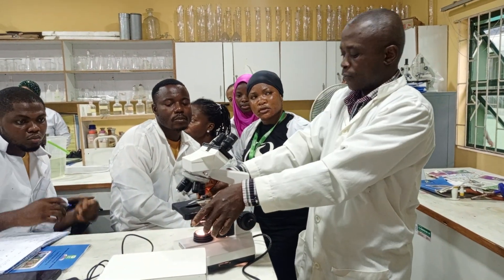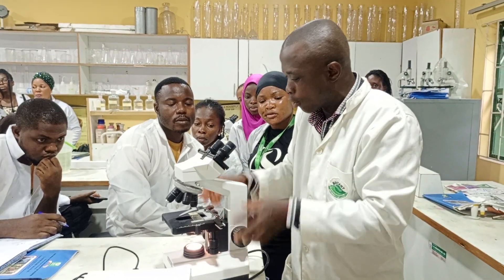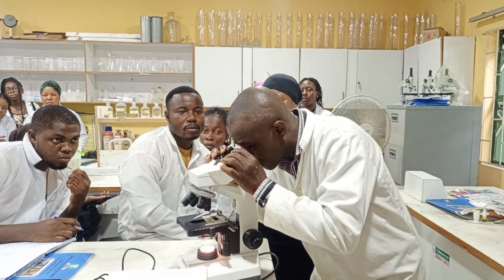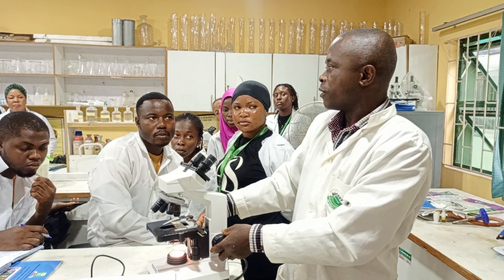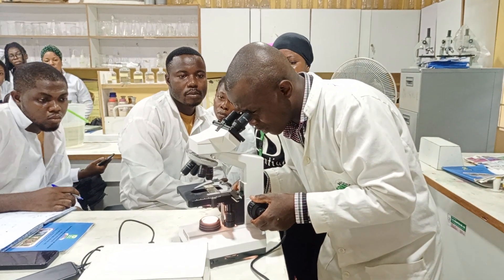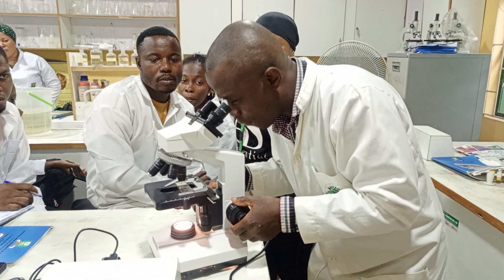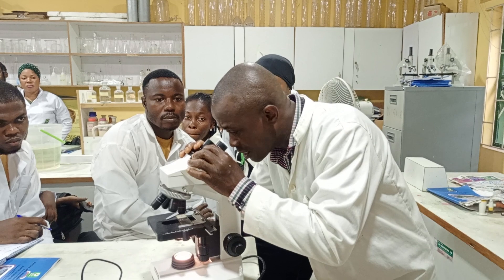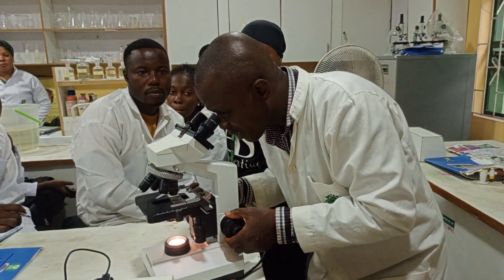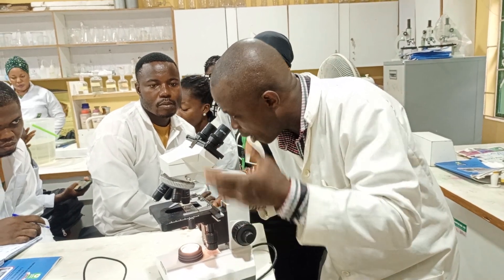After you have brought the stage down and mounted your slide properly, fix your eyes in the ocular and do not look away. You must not make any move without your eyes being fixed here — if you make a move without looking, you can reach the focal length and not know it. To bring the object to focus, you raise the coarse adjustment knob gently. At first the view is clear, but as you raise it up gently you will start to see some colors trying to appear, as if it's getting cloudy — that means you are about to see your specimen.